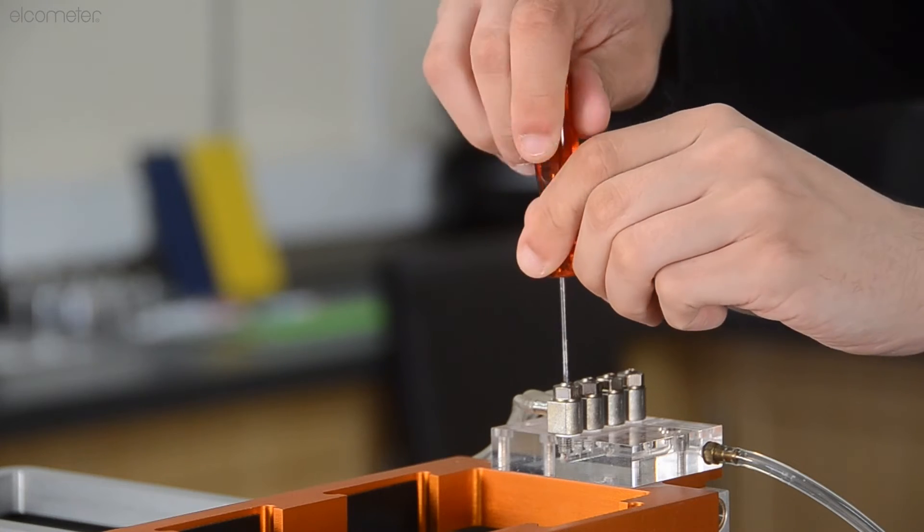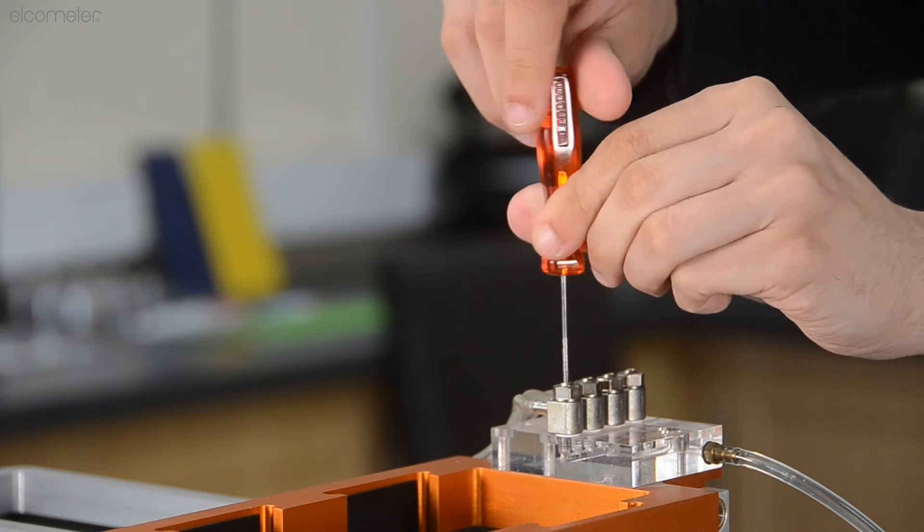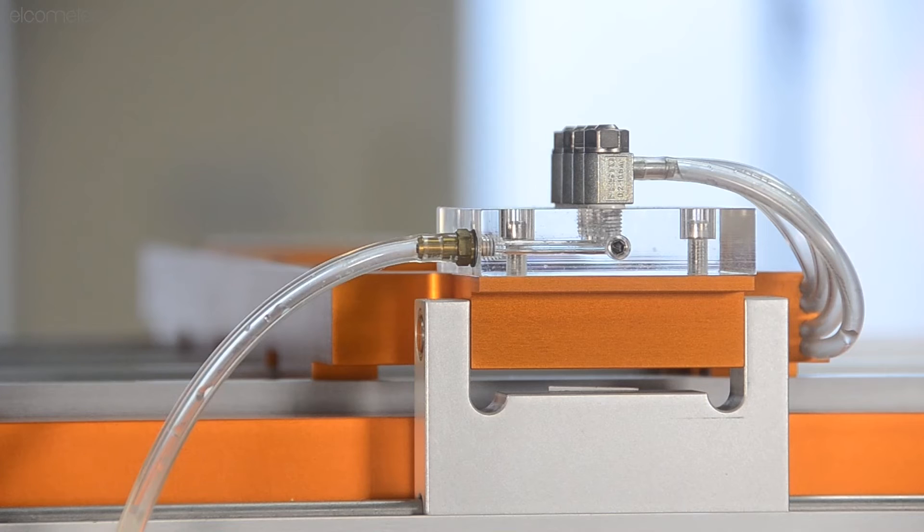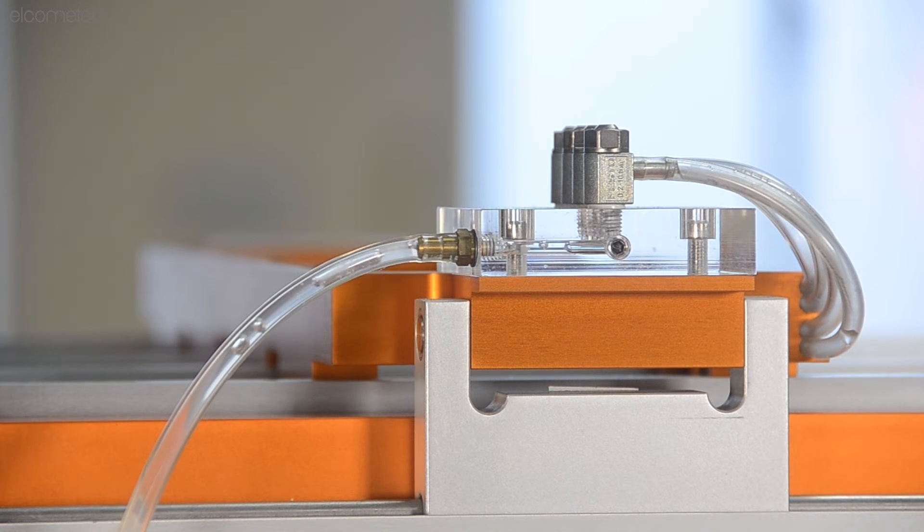Purge the air from the liquid delivery pipes using the provided screwdriver, waiting until there are no more air bubbles left in the pipes.